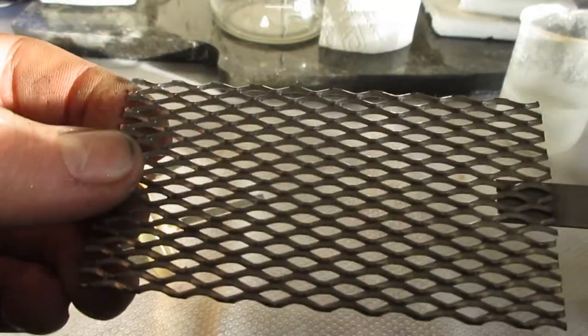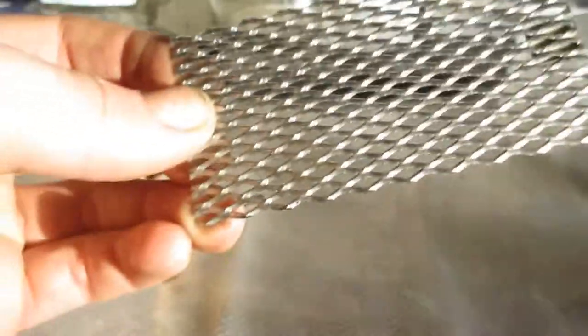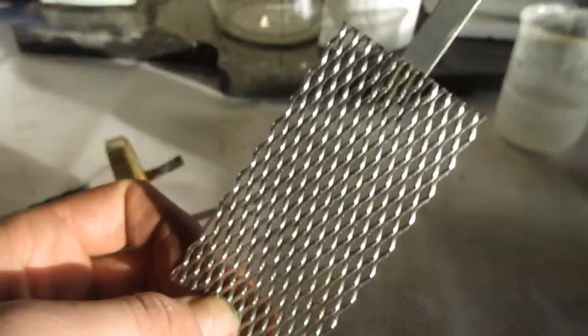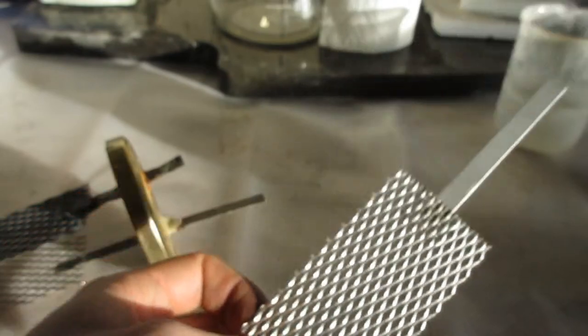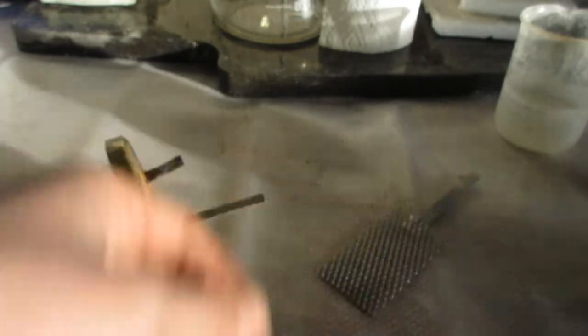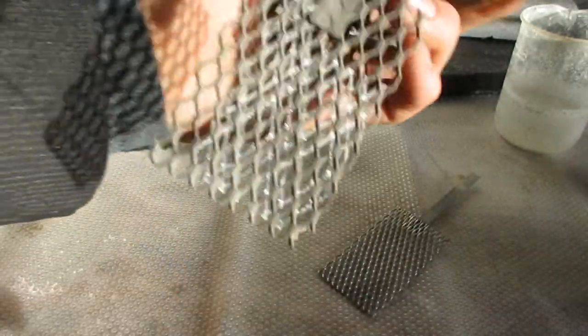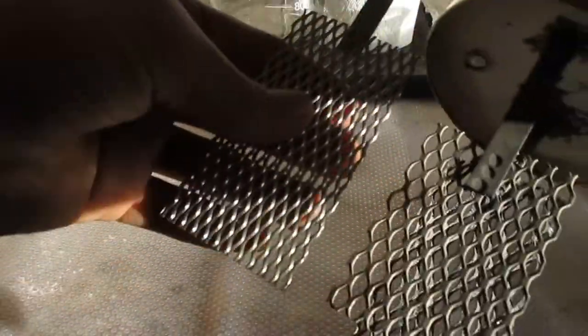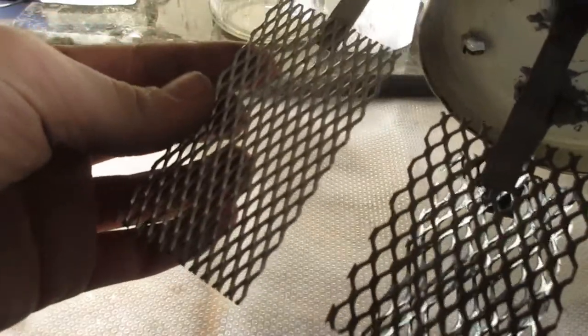Nothing like that. And also there are other ways of telling, but for the most part, I'd say that this is the best way so far. All of the genuine ones I've seen have this coarse dark grayish texture, and they're all fairly easy to distinguish.